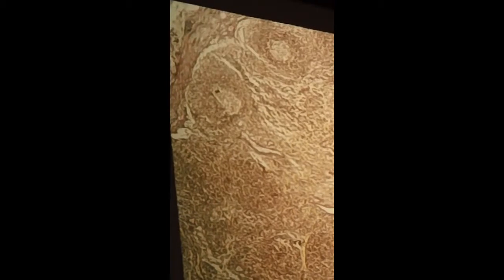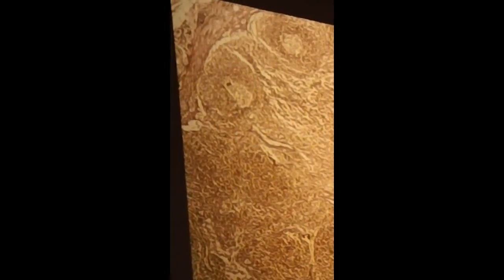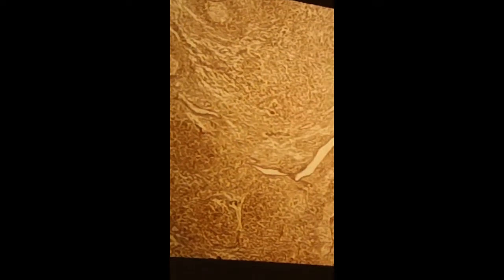Okay, silver stain of a lymph node. And we see up here, we've got what kind of connective tissue? It's the capsule of a lymph node. And our histofacts tell us that that's dense irregular connective tissue. All right? You can see some lymph nodules here. And if we get down into the medullary region, clearer, at higher power, here we have these beautiful, what kind of fibers? And there are what kind of collagen?